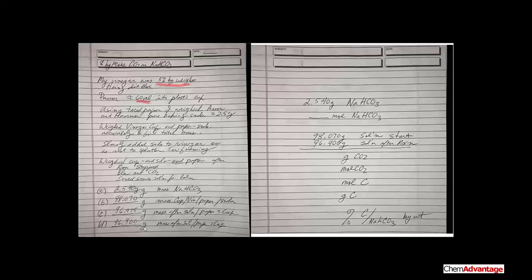The real heart of the experiment is that here we had a very carefully measured weight of sodium hydrogen carbonate, which I've repeated here in my calculation section: 2.54 grams. Now remember, on this balance the last digit is either a 0 or a 5. It's sort of an estimate. So in terms of being a reliable value, it's 2.54 grams. Now you could change that into moles and then compare that to the moles of acetic acid, and you'll find out that the sodium hydrogen carbonate, the baking soda, is the limiting reactant.